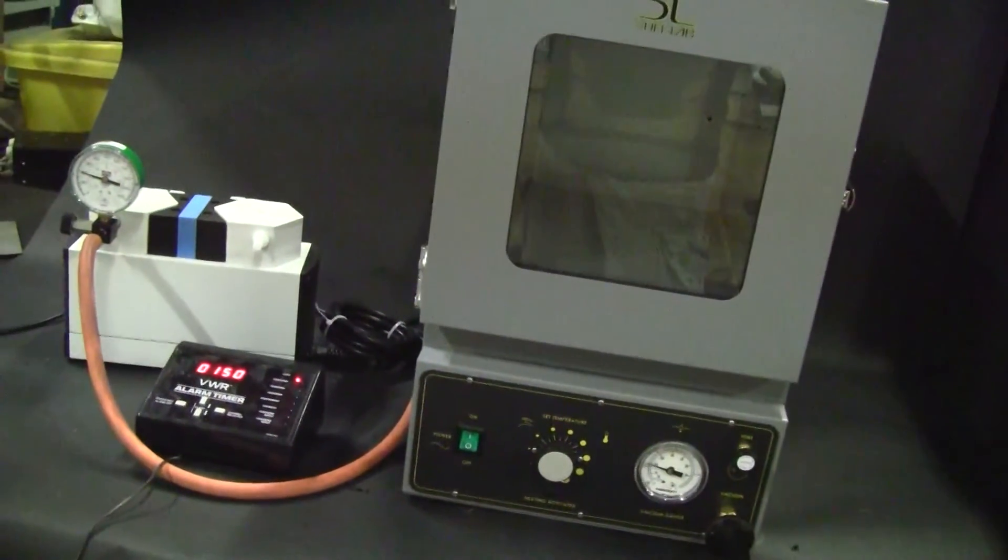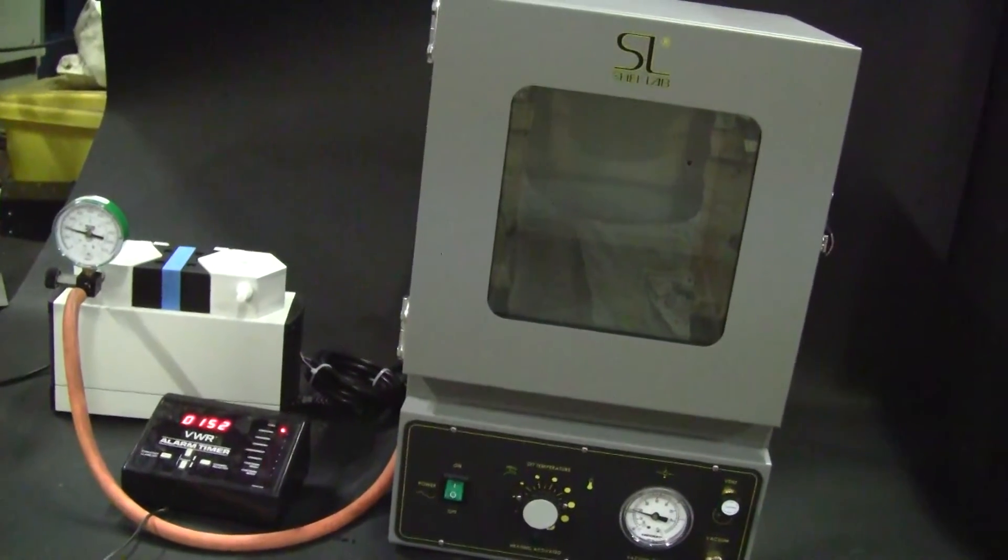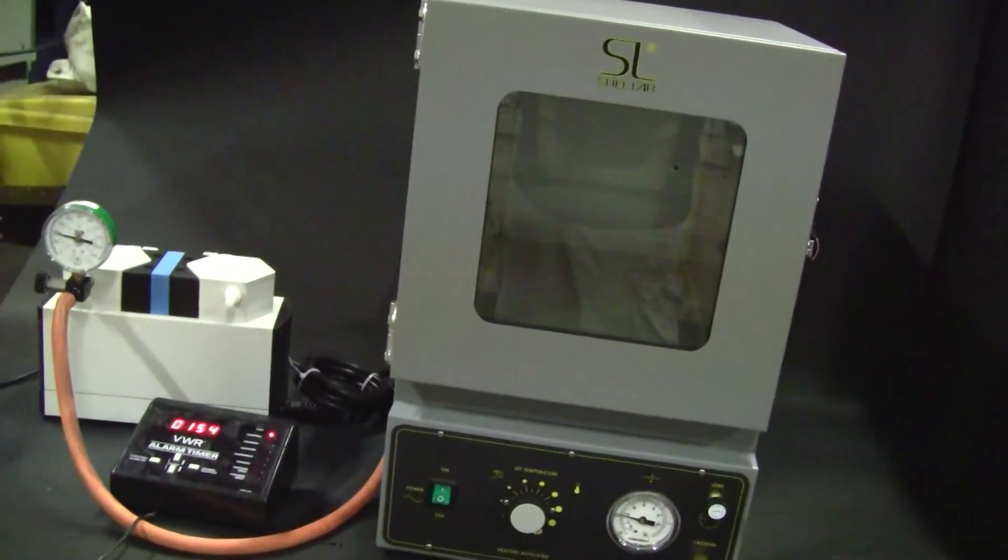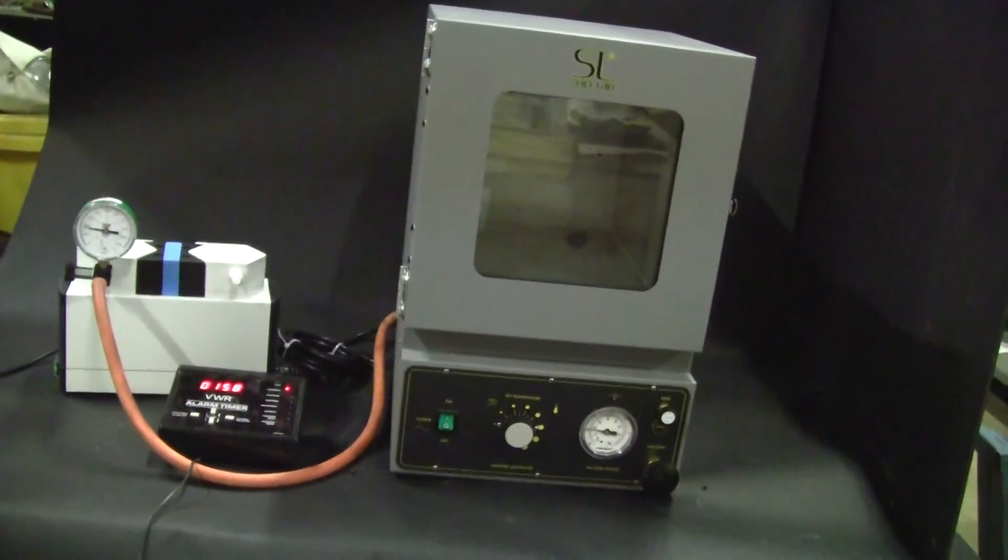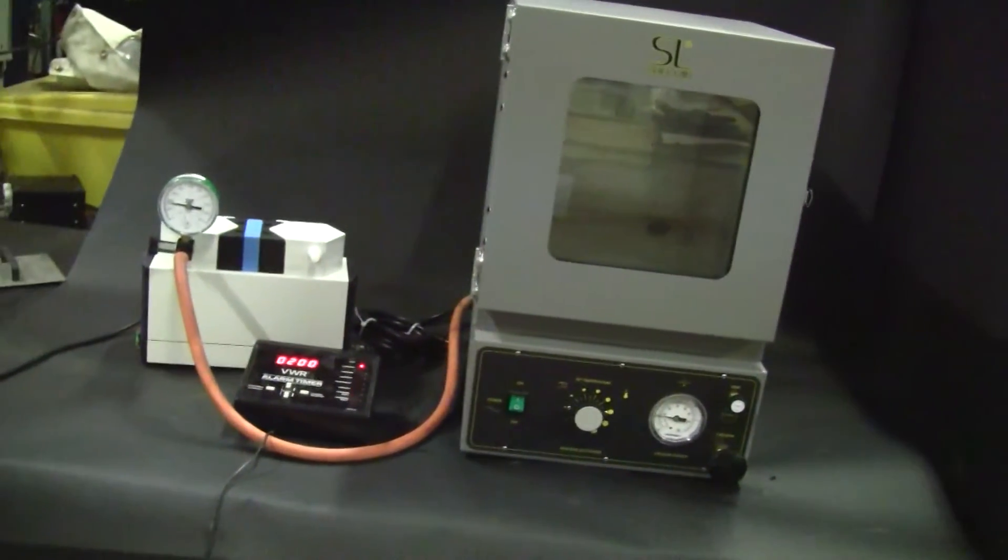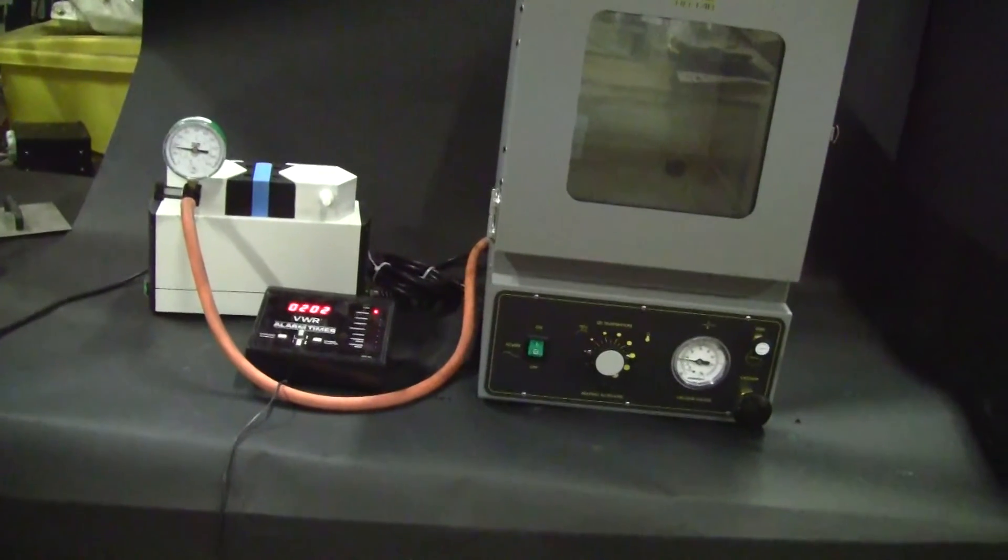It does look like we're going to achieve our 100 millibar vacuum level, or 28 inches of mercury, within our 2 minutes and 30 seconds, as we see it count down quite nicely.